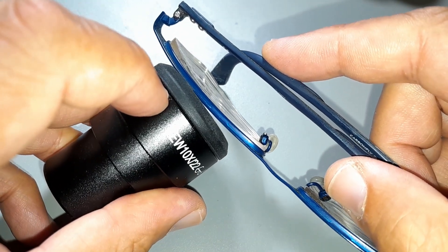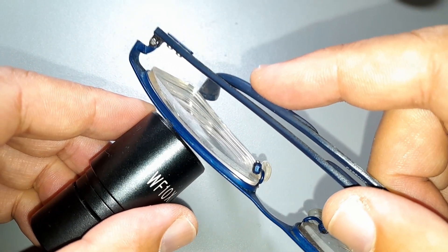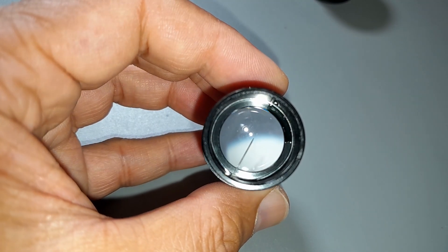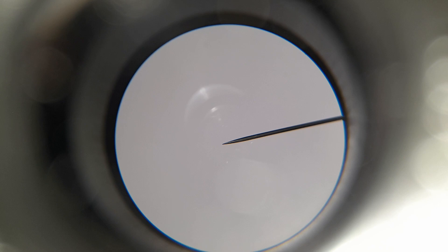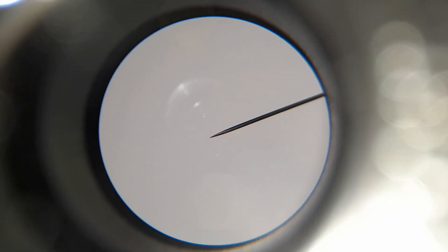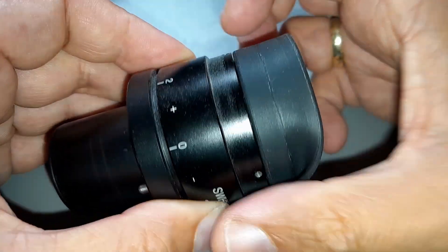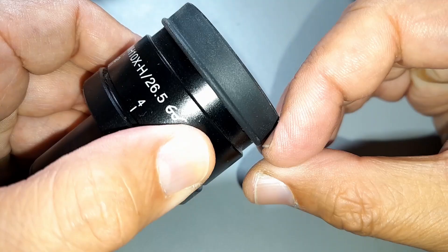Some eyepieces have a rubber protection on the outside, so if you rest your eyeglasses on top they don't become scratched. Cheap eyepieces are quite harsh on eyeglasses — I've already managed to damage some of mine by scratching them. Some eyepieces also have a little needle on the inside — basically an arrow — which can be used for pointing at different objects under the microscope. Those arrows can be removed if they disturb you, though they're not ideal when you want to take pictures. You can also replace them with micrometers and other inserts. Some eyepieces have a rubber cup on the outside which also allows you to adjust the eye relief.